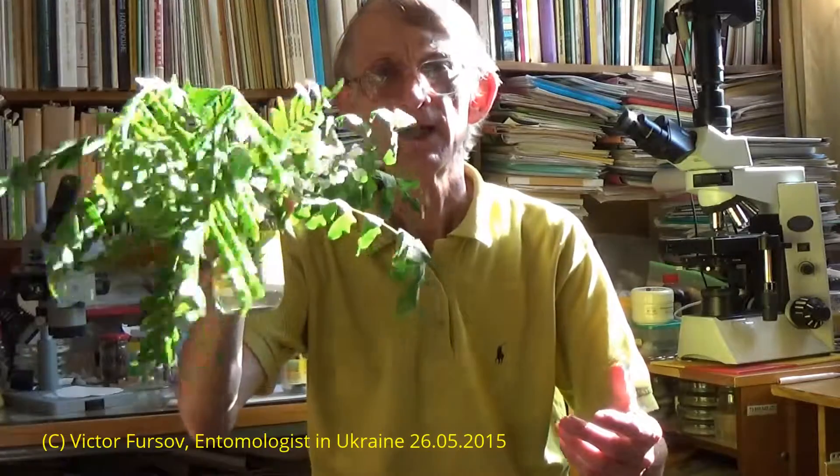Honey bee is collecting honey from these plants. First of all, I will show you just a tiny plant and tiny pollen of Convallaria majalis, or lily of the valley, a very simple plant. Probably no honey from lily of the valley, but I will show you, because it will be interesting to compare 3 different species of plant and 3 different types of pollen, but others are very important for collecting honey.